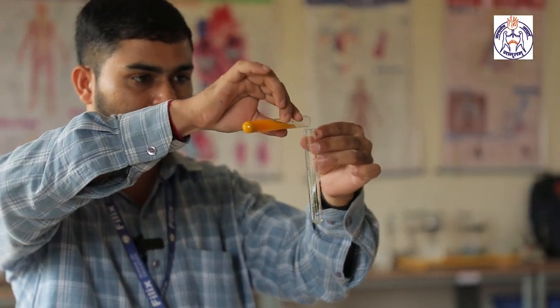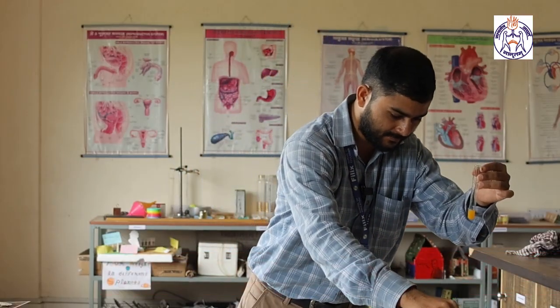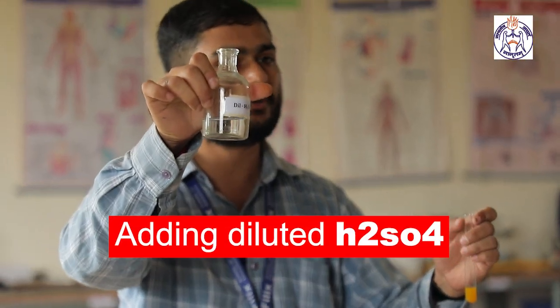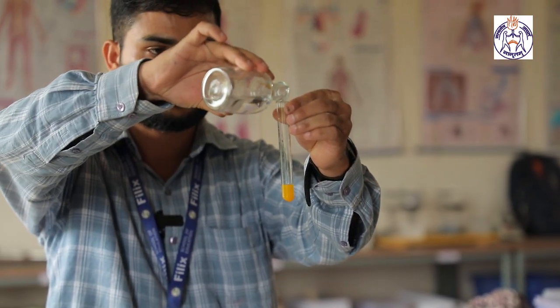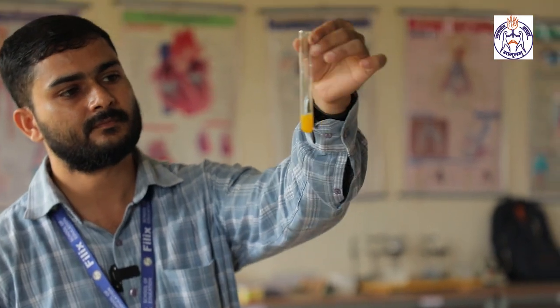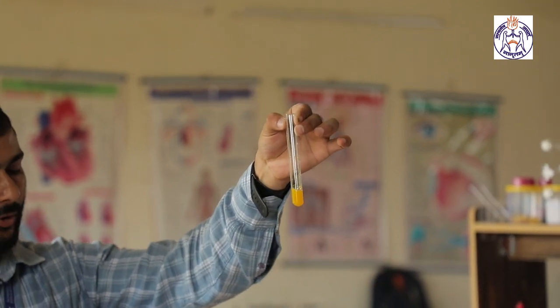It is a yellow turmeric solution. I am taking the turmeric solution in one test tube. Now I am adding dilute H2SO4, as we know it is an acid. I am adding that acid slowly, just a few drops. Observe, there is no change in color. That means the yellow turmeric solution remains yellow. So there is no change in color.